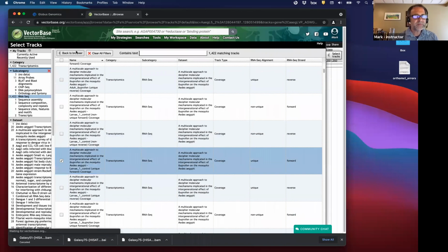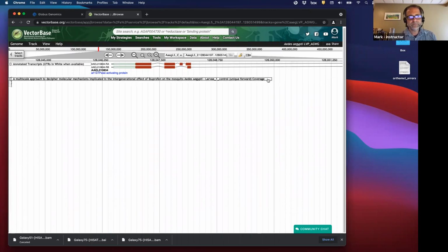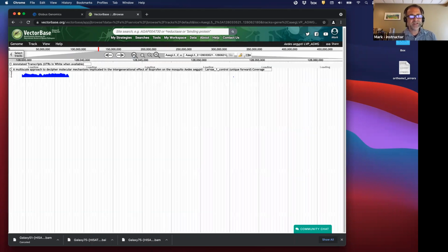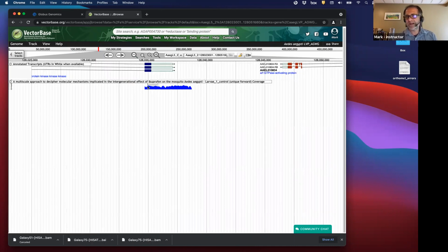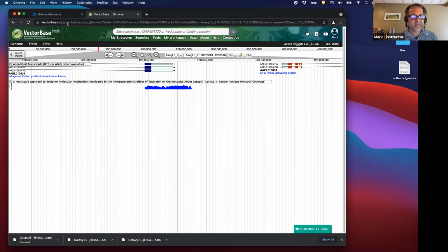And here is one example. It's just not showing up. Let me zoom out in case there's no expression in this location. And that is indeed the case. So this is a Bigwig file. I take the BAM file, and then it looks at every position and figures out how many reads overlap that position. And that's where you get the height of that histogram. So that tells you where all the reads in general are mapping. Okay, so that is a Bigwig file. You can actually even look at this save track data. Actually, that's another form, a bedGraph, but it's very similar in producing a histogram of the reads.